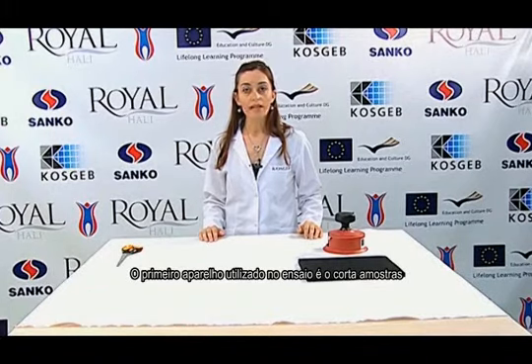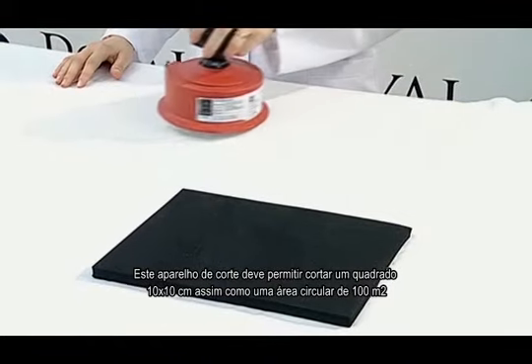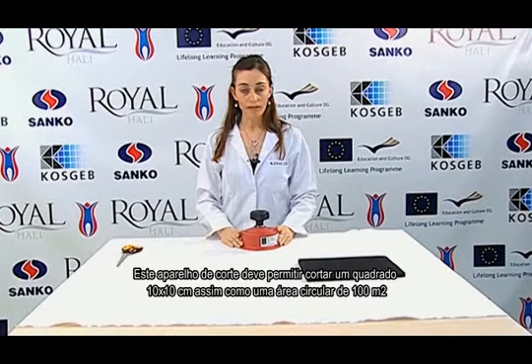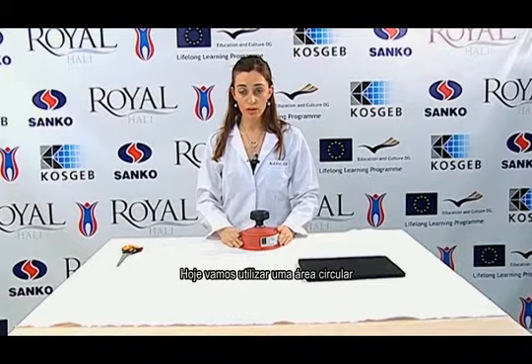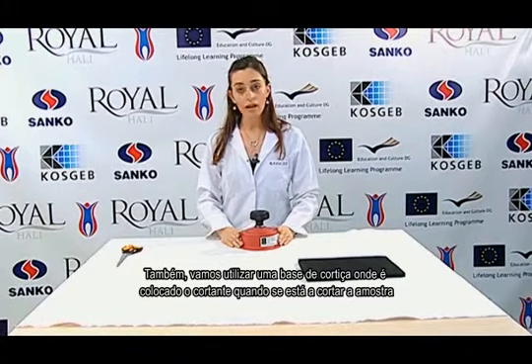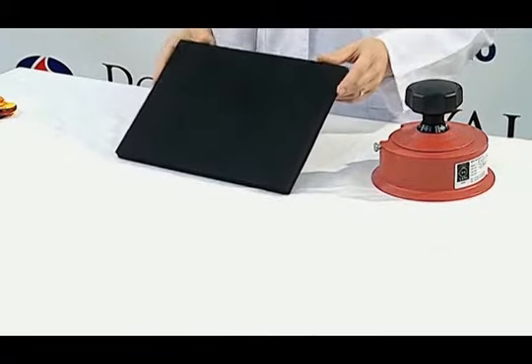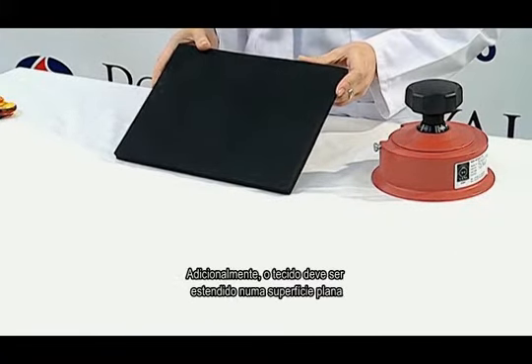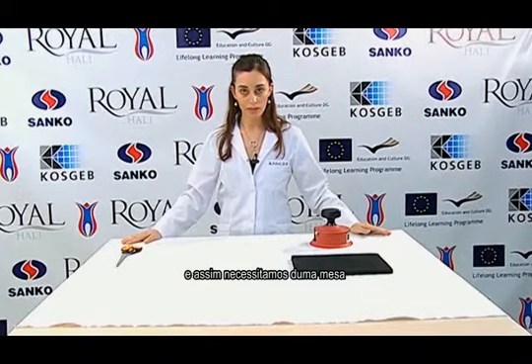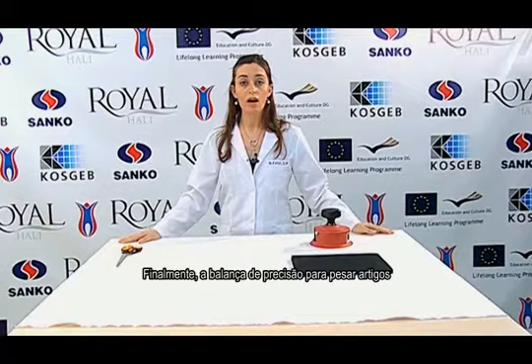The first device that is used in the test is the sample cutter template. This template can cut a 10 by 10 square centimeter piece, as well as a circle with an area of 100 square centimeters. Today, we are going to use a circular area. Also, we are going to use a cork plate on which the cutter is placed when cutting the sample. Additionally, the fabric should be laid on a flat surface, and thus we need a table for this. Finally, we need a precision balance to weigh the items.